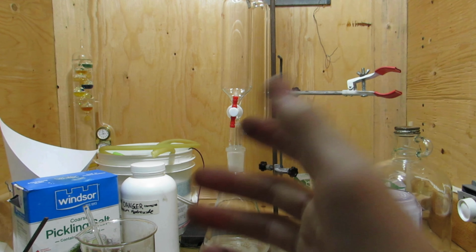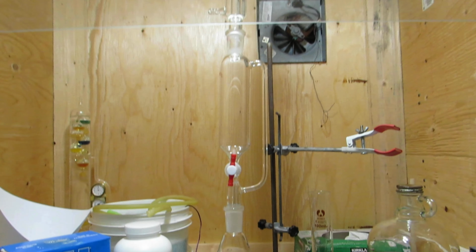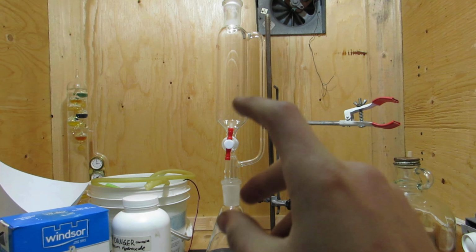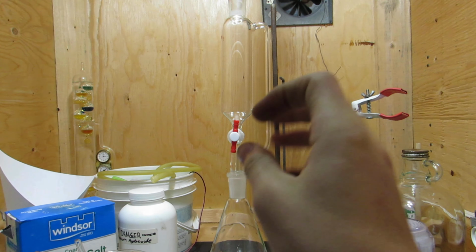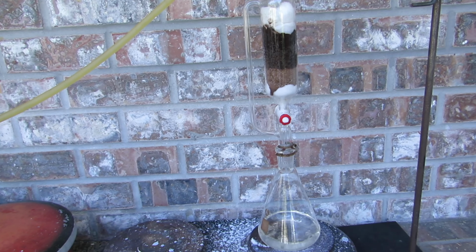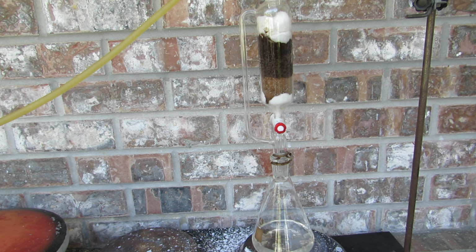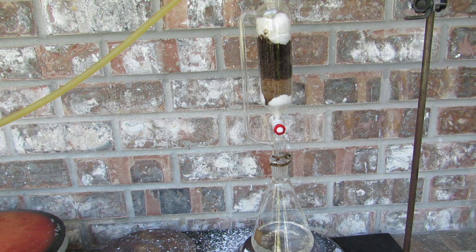By placing the pressure equalizing addition funnel on an Erlenmeyer flask and attaching a condenser column on top of the addition funnel, the dichloromethane will climb up the side arm of the addition funnel, condense in the condenser, and fall into the funnel with the cocoa powder. By slightly opening the stopcock, the dichloromethane will continuously cycle over the cocoa. Theobromine has low solubility in dichloromethane, which is why it is necessary to cycle solvent over the cocoa. The magnesium compounds generated earlier are insoluble in dichloromethane, so they will stay in the funnel.